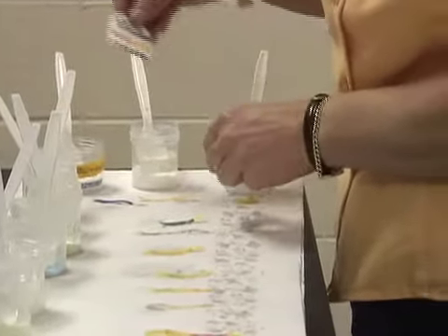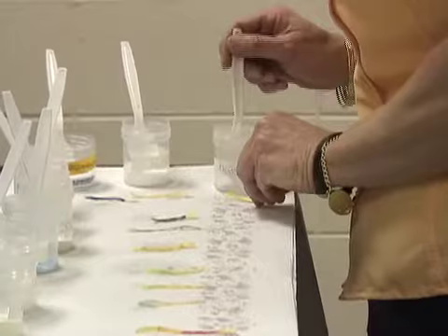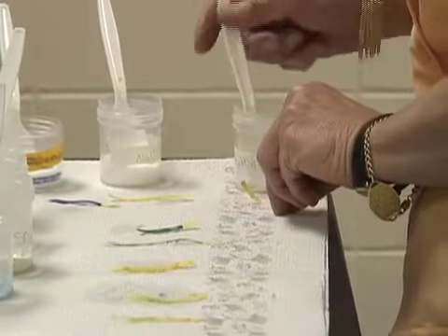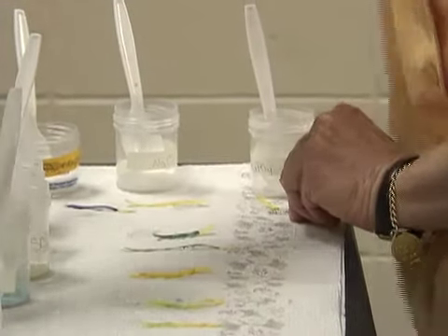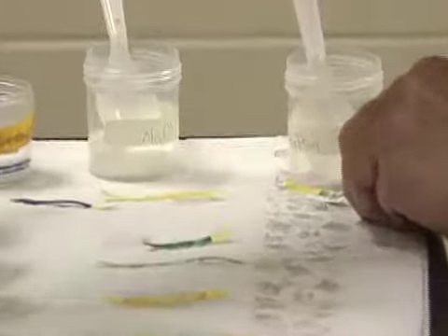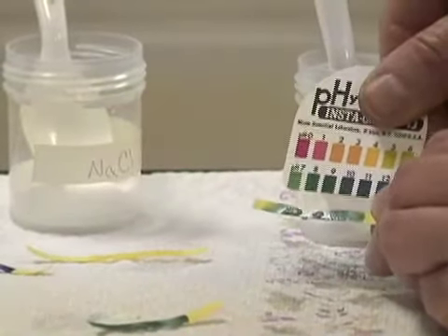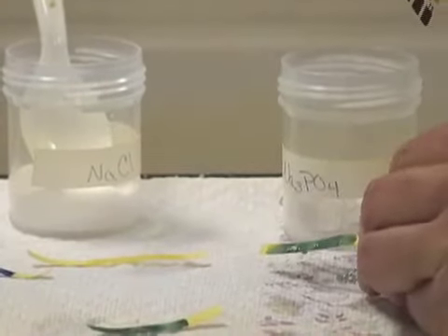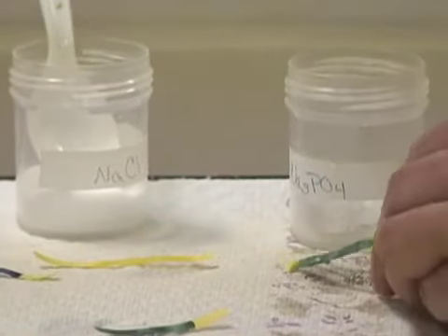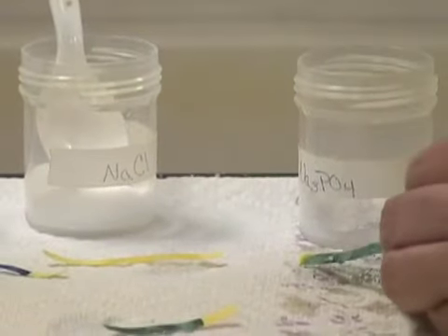The last salt that we've been given is sodium phosphate. I'll add my crystals. Then I'll add my drop of water. And that is also a deep blue color. I don't really want the crystals on the pH paper, so I can read the color. I'd say that was 9. So sodium phosphate, accidents in lab happen. That's why we have to be prepared with our safety goggles and things. So I would say 9, and sodium phosphate would be a 9.